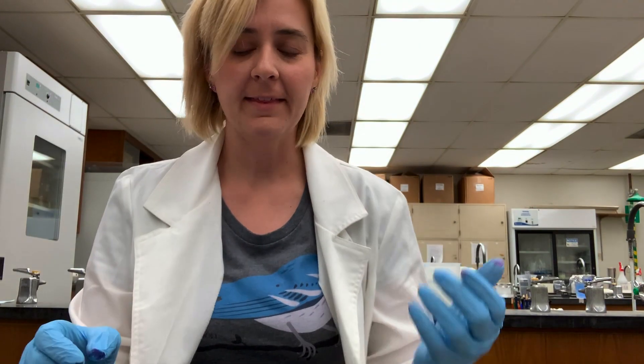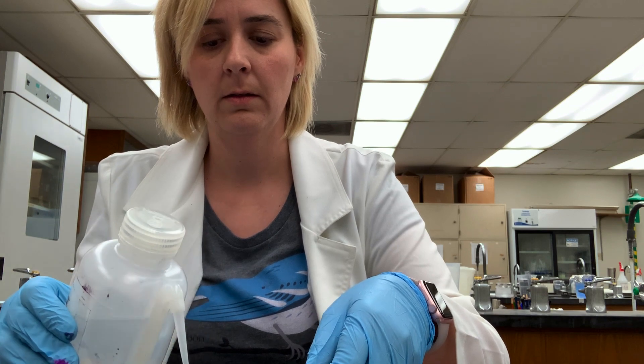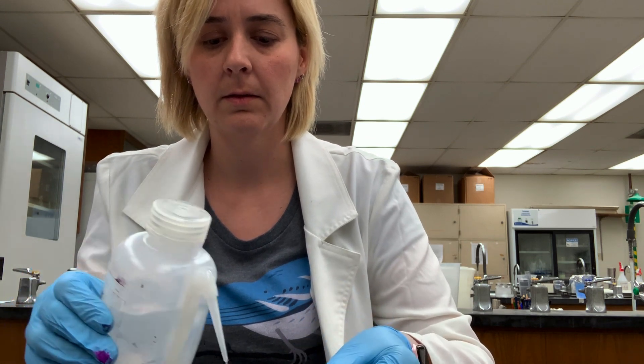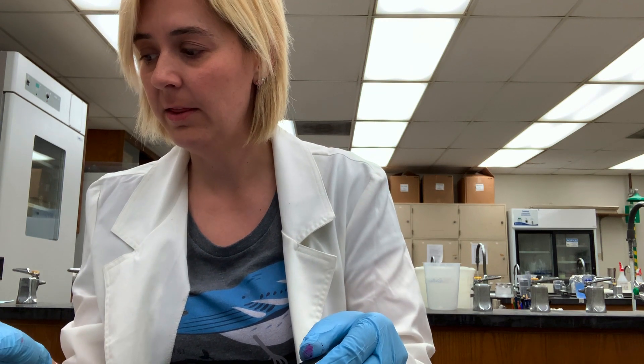Back in the lab, my next step is to rinse the slide with water. Now we're going to do a decolorizing step using acid-alcohol — acid ethanol. This works a lot like the decolorizing agent in a gram stain: it should pull the carbolfuchsin from any cells that don't have mycolic acids, while leaving cells with mycolic acids holding on to that carbolfuchsin. We'll add it drop by drop until the color stops running.